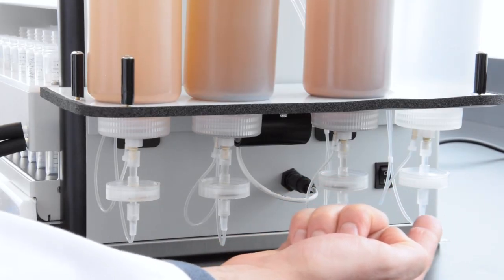All right, so we just finished with the basic methanol preconditioning and formic acid equilibration steps. The pumps are now drawing from the eight samples and delivering them through the SPE cartridges. That's right, you can already see the inline filter doing its job to trap sample particulates. Well, here's another question for you. I know most labs never receive samples that are exactly 250 milliliters or 500 milliliters. So what would you recommend in terms of setting the sample loading volume?